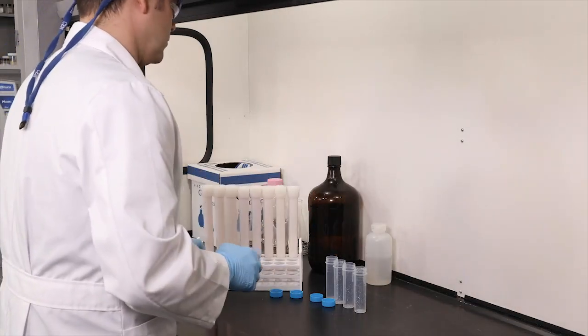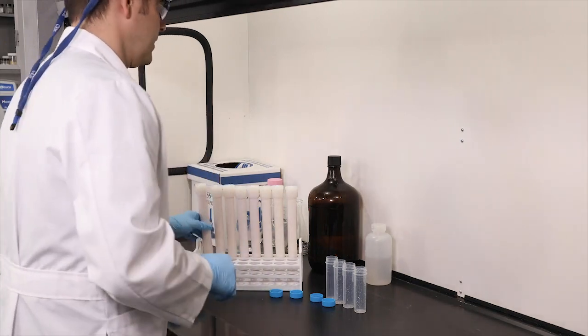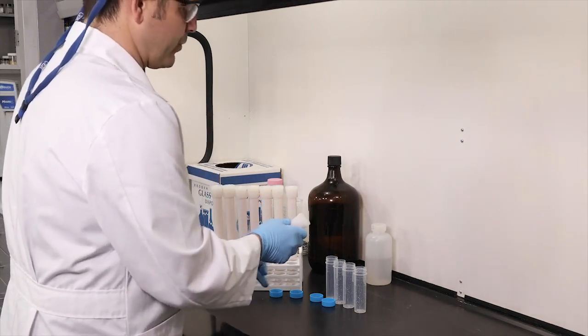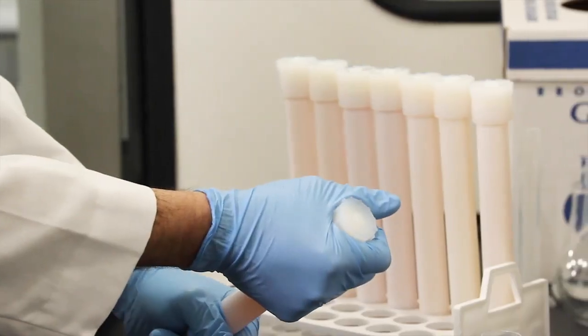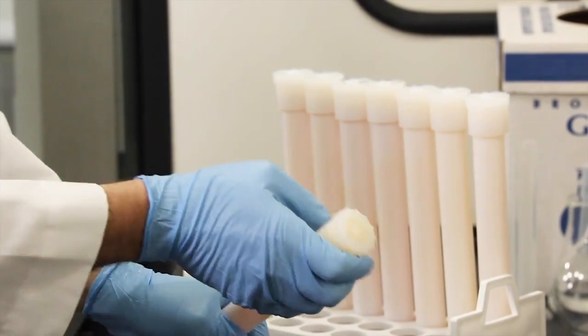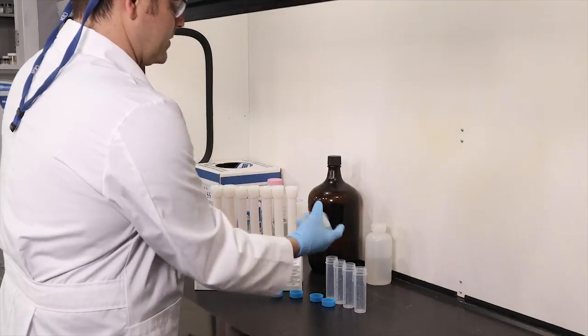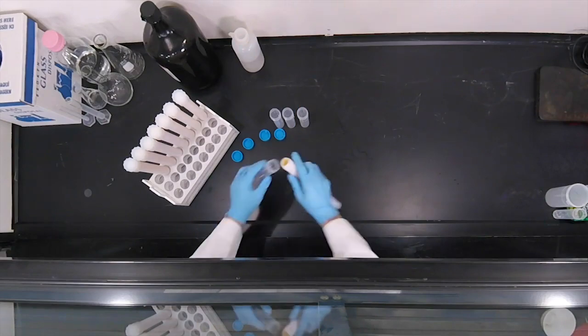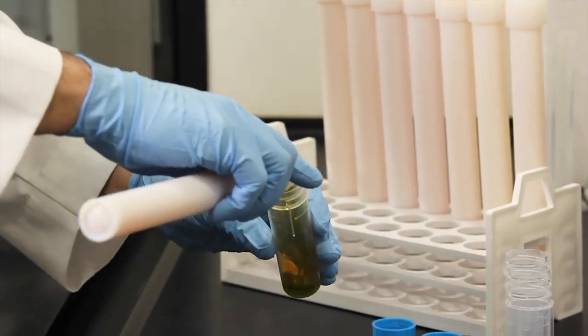Okay, now that our samples have cooled, time for dilution. Now remember, leather is the organic matrix and that's why we did our pre-digestion step earlier, so we should see some good gas generation. Look at that, beautiful. All right, this was the soccer ball. Let's see what we get.